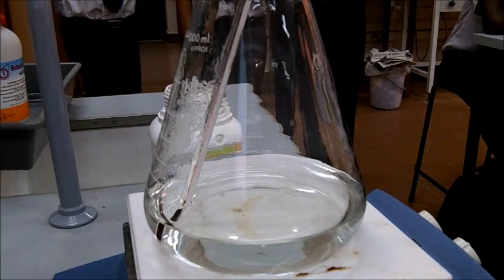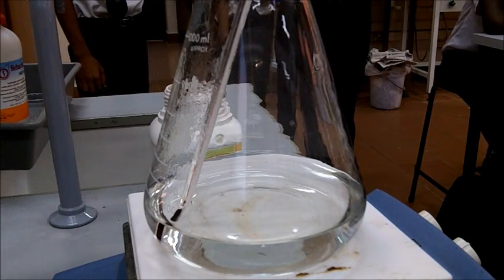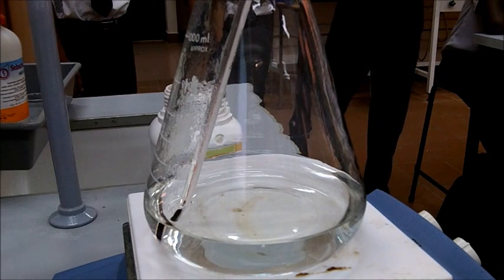So that's the peroxide and the tartrate at around 55 or so. What's happening? Well, no, because I haven't added the catalyst.